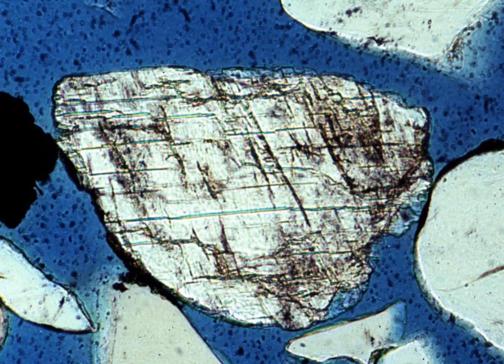Notice also that what we're looking at here is the scale. 50 microns across is the amount that we're going to be able to see. And then finally, it's going to tell us what image we're on. You'll notice that I will be moving the cursor around the image like this, and as long as it stays an arrow, that means I cannot click and receive new information.